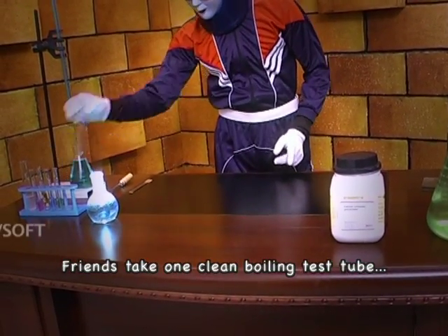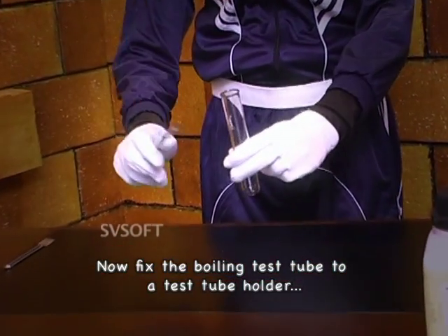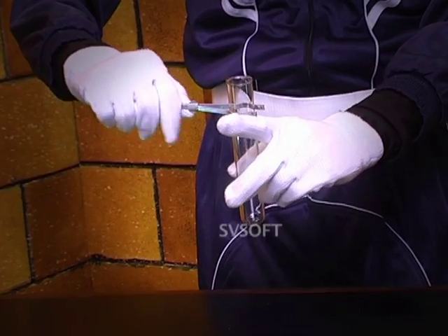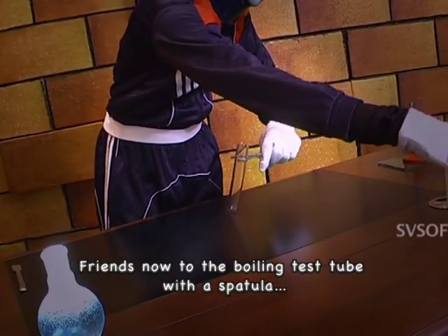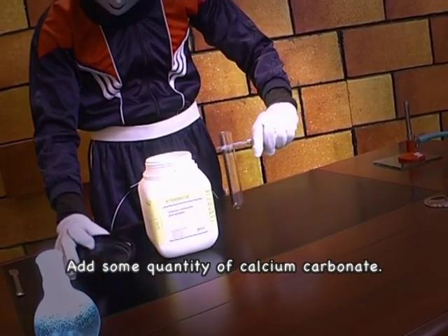Take one clean boiling test tube. Now fix the boiling test tube to a test tube holder. Friends, now to the boiling test tube with a spatula, add some quantity of calcium carbonate.